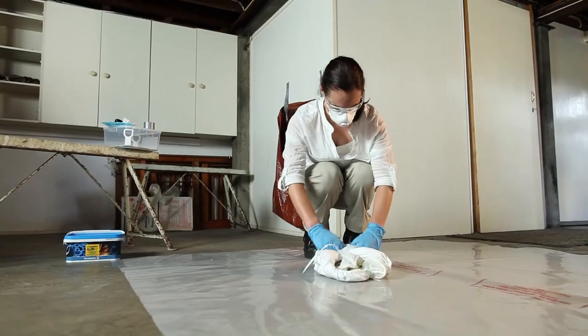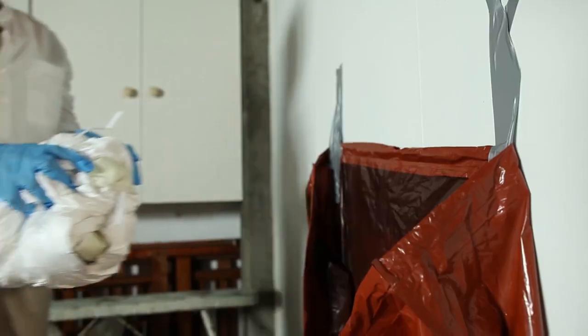Remove your legs from the coveralls and step back onto them. Then, you can untie and untape your disposable boot covers. Roll your coveralls and boot covers into a ball and place them into the waste bag.